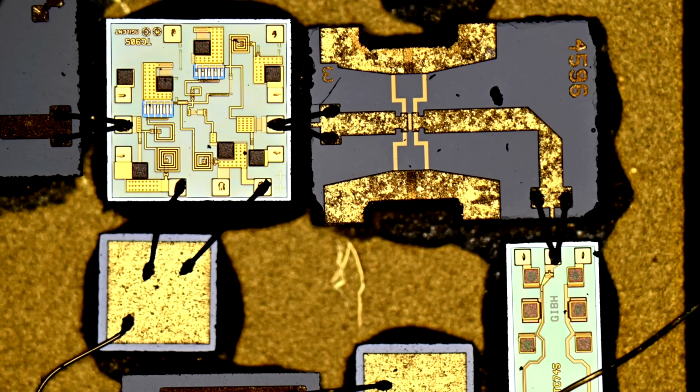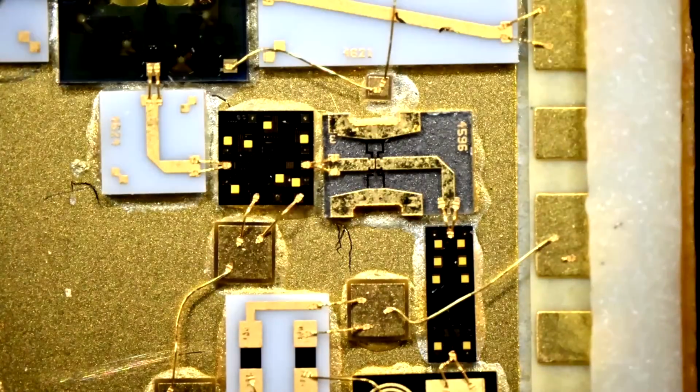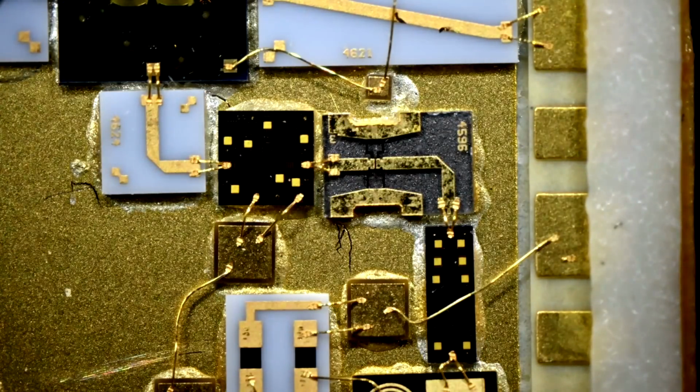Then we can go even further back. This is a 2.5x lens, which gives you a magnification of 25, and you're looking now really, really high up. Even in these situations, you could run into similar problems. Now, you could put this into dark field, which is going to give you a very different kind of image. I'll switch it to dark field here and give it a bit more light. And you can see the structures totally differently, which is really pretty.